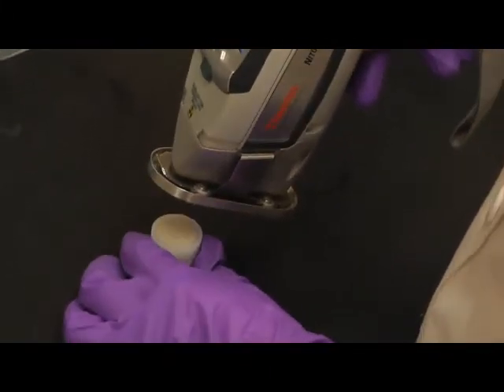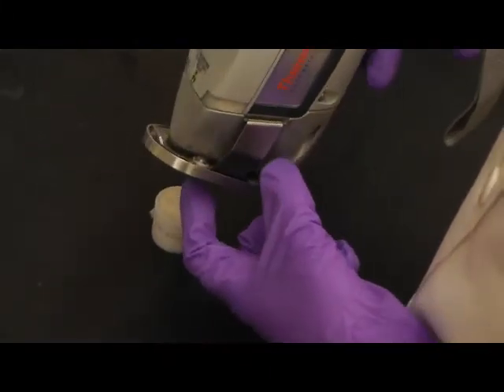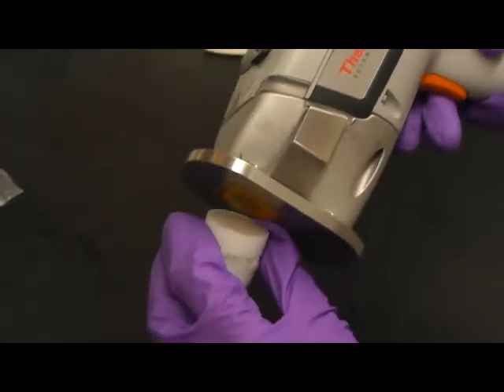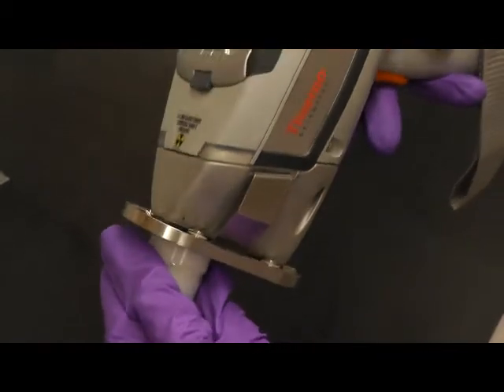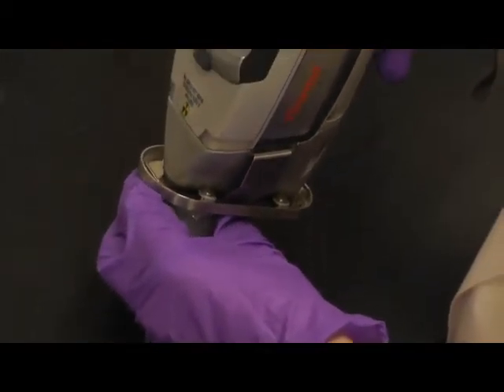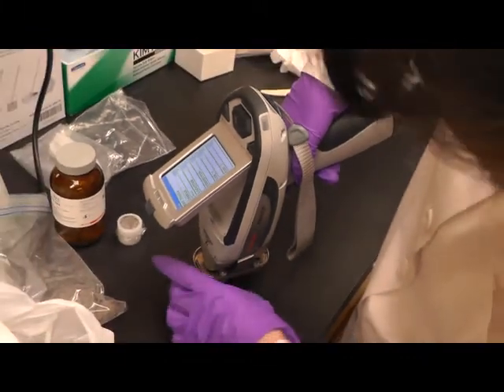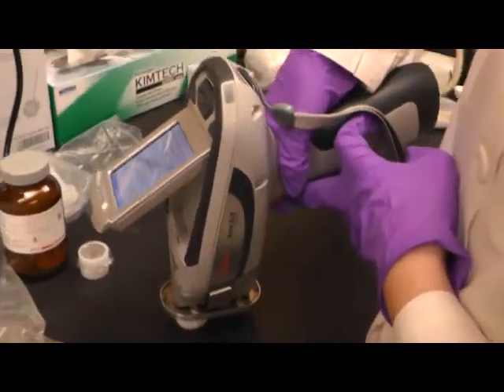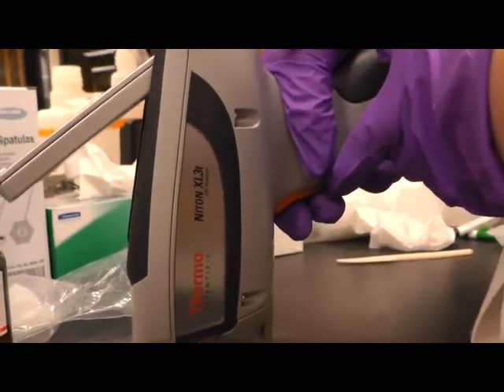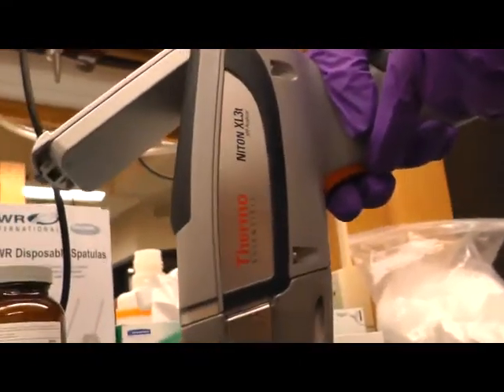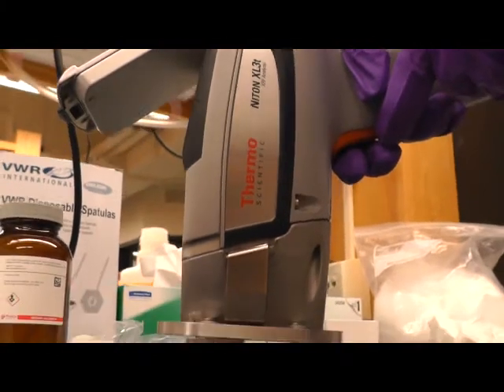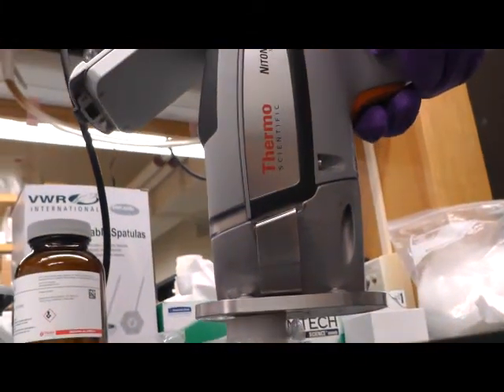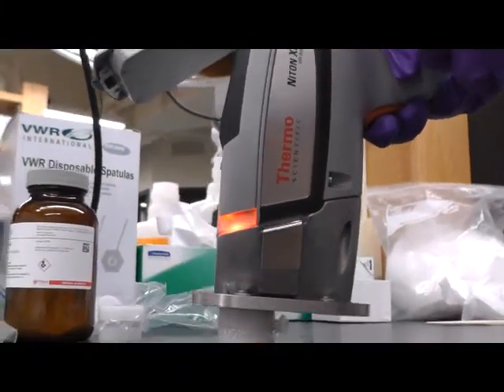Right now we are going to align the hole on the XRF with the surface of soils. And then there is an orange button. Press the button which will start the measurement. And we want the measurement to be roughly 90 seconds. Here we go.